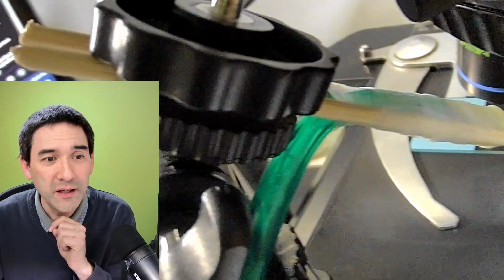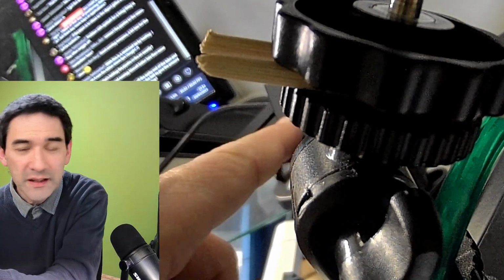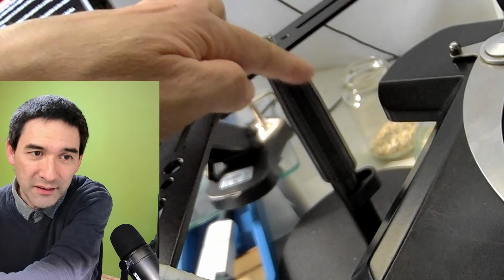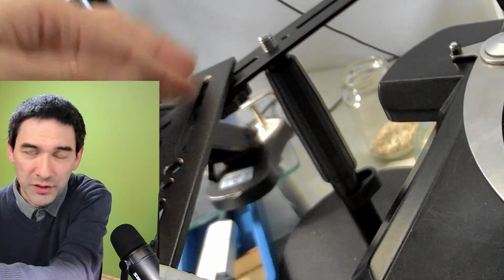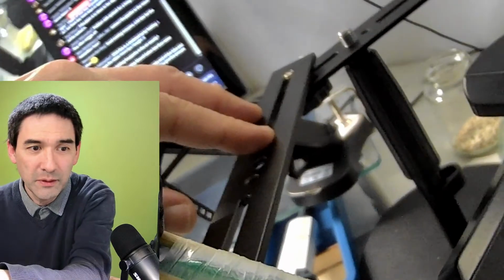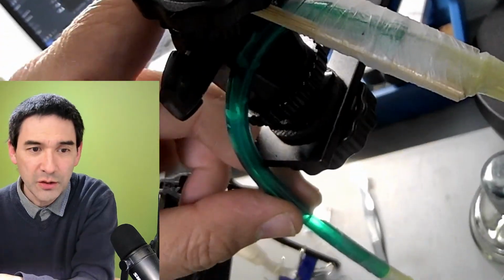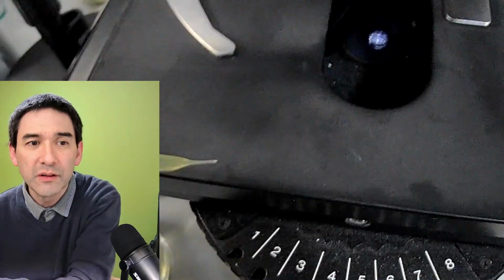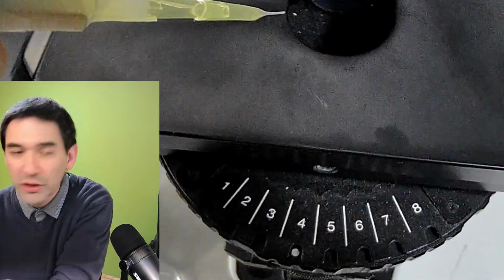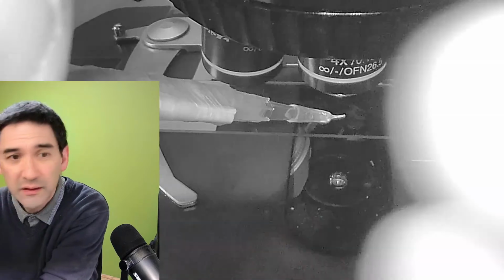And now what's kind of holding it up in the air? Basically, look what you see over here. You see my computer screen here. This one over here, right? I'm going to move it away. That here, that is a microphone stand or a camera stand. So that's basically just any kind of stand that you have, and I just used my camera stand and I connected this here, and to that, I connected then here at the top, this contraption that I made, and over here there is this air tube, right, and over here, you can just basically swing it over like this, right, and then you're able to position it directly over here, directly.